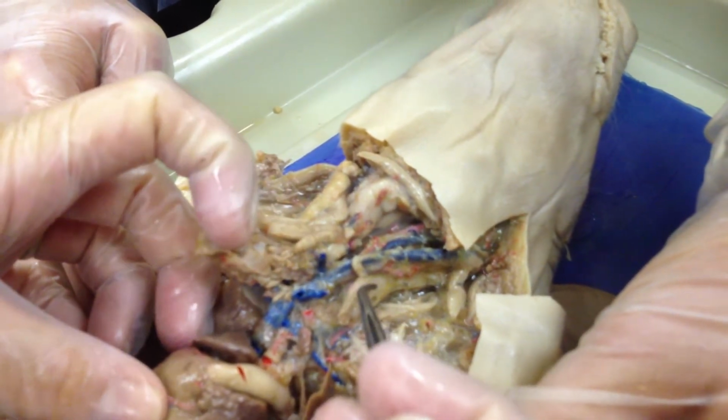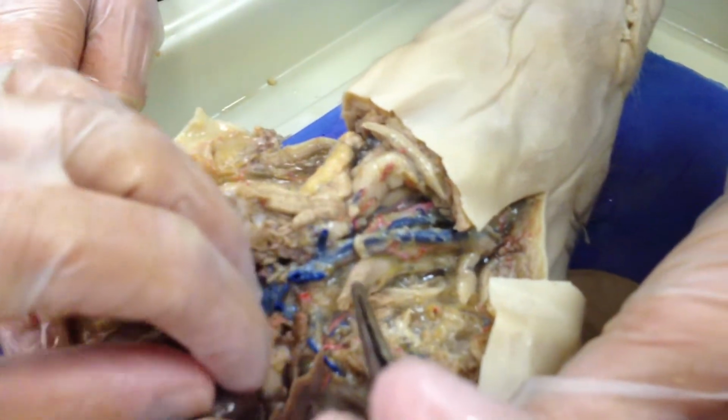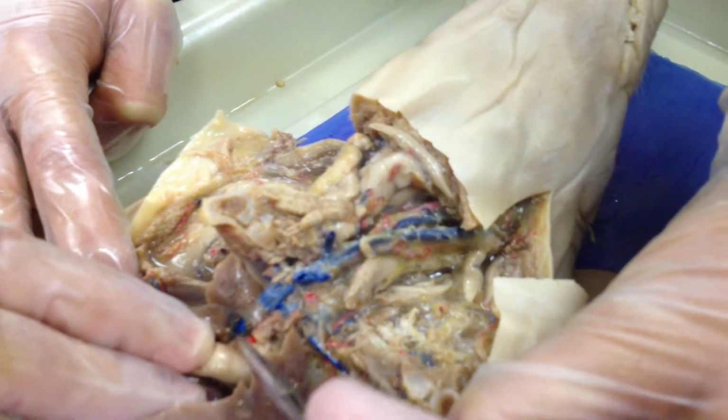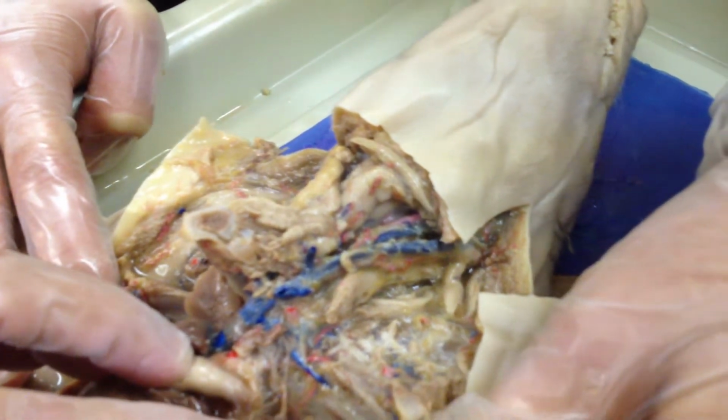Okay. Brachiocephalic trunk. So the brachiocephalic trunk is going to be one of those BCS guys that comes off the top of the aorta. So if you found your aortic arch, this one is your B. This is your brachiocephalic trunk right here. Subclavian arteries, right and left.